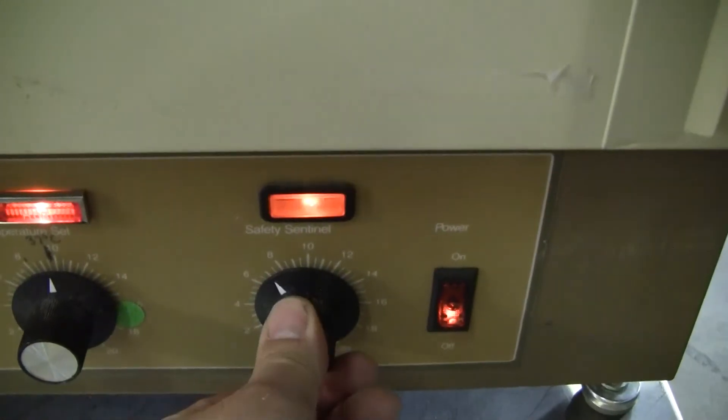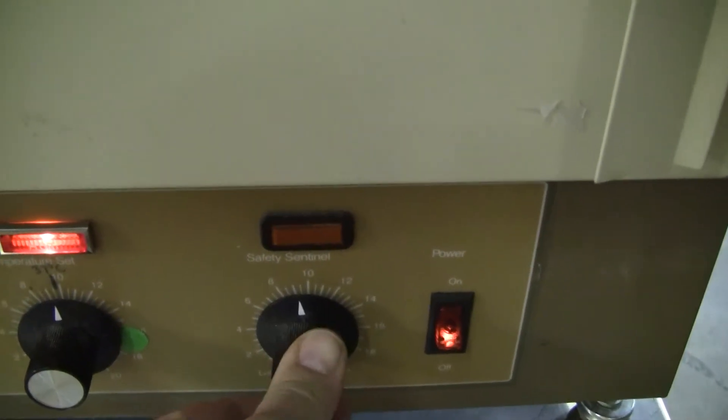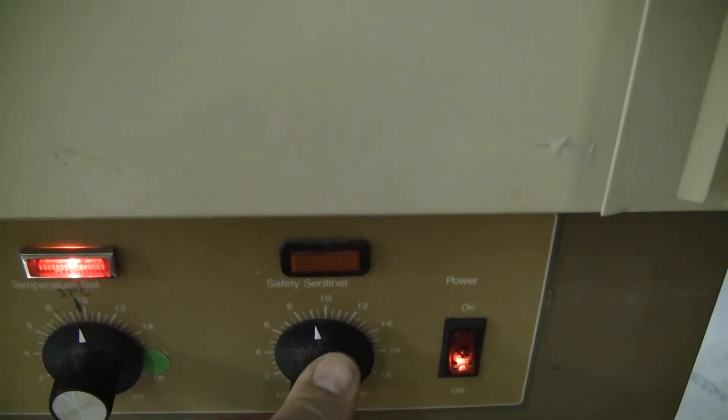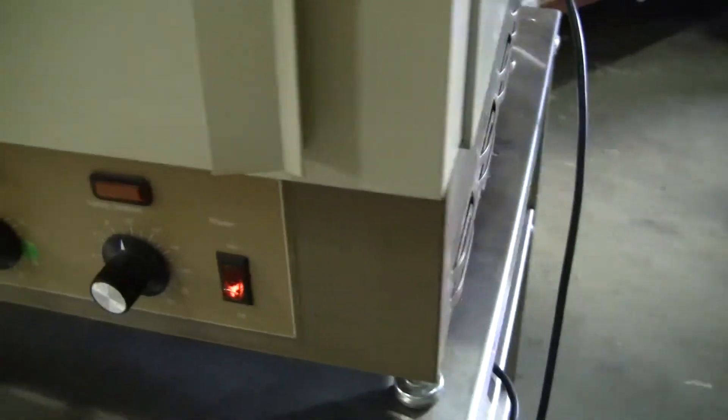Your overtemp, so your samples don't get hurt, that cuts the power. Power on and off.